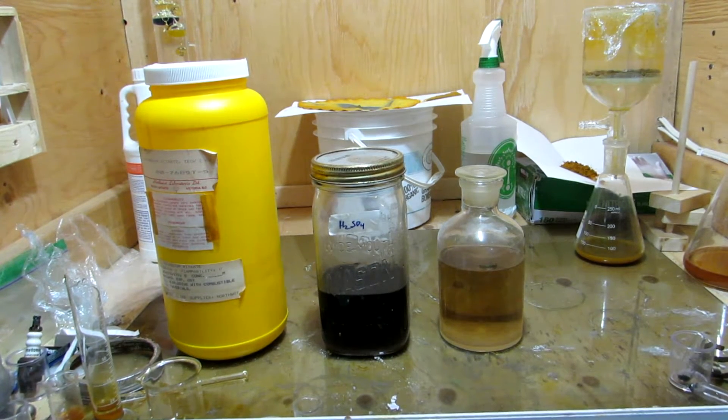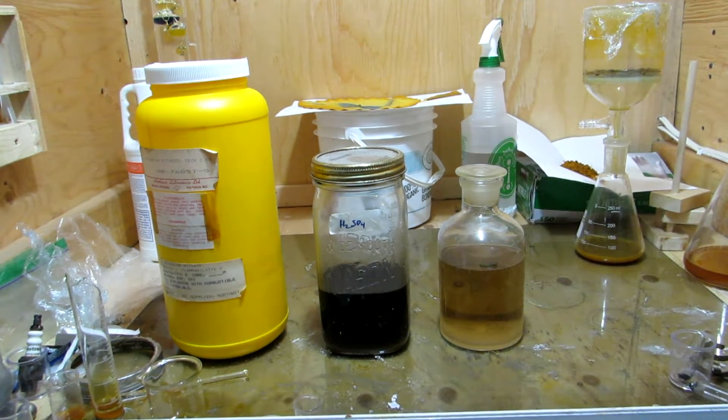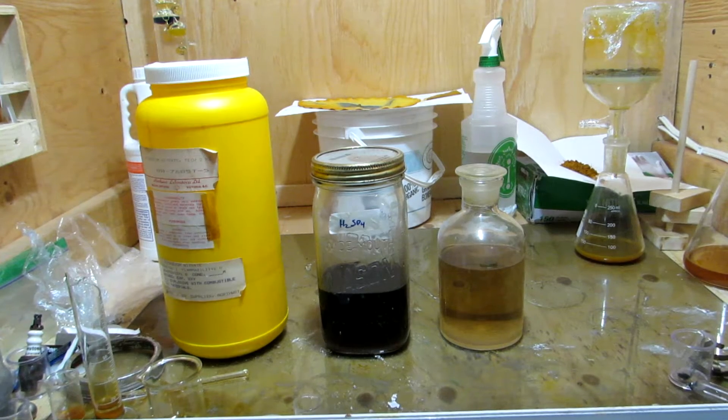Hey guys, and welcome back to another video. Today we're going to be making some 68% concentrated azeotropic nitric acid.